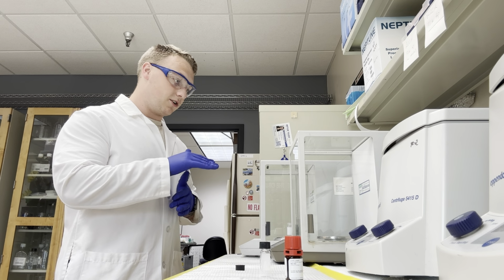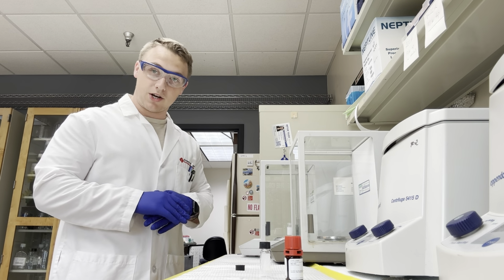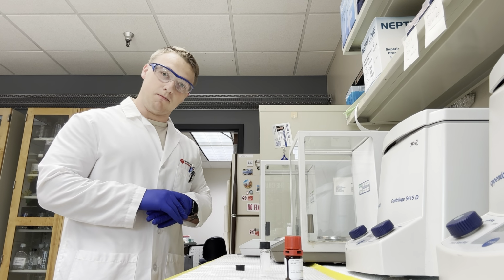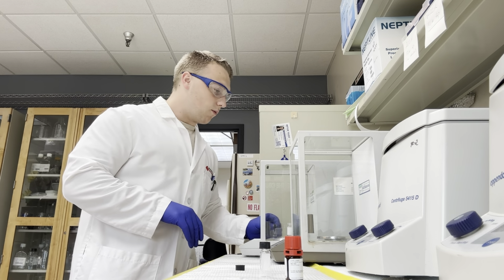With these particular scales, we have to be very careful because even a little pressure on the counter can disrupt its measurement process. It can make it a non-zero measurement. It can add weight to our samples. So we just need to be careful and mindful of that. So try to stay away from it while it's zeroing. And now it's zeroed. We're going to take it out.